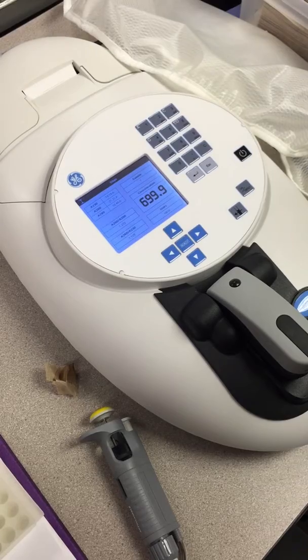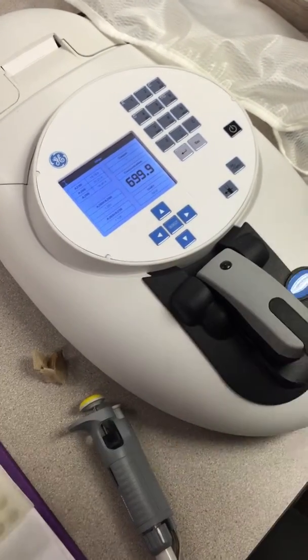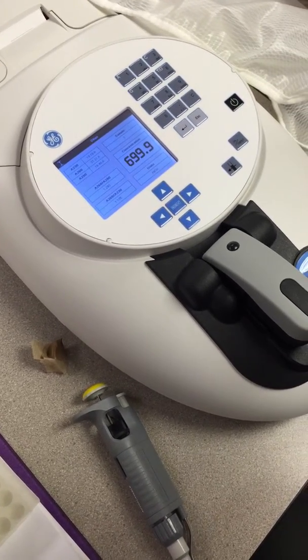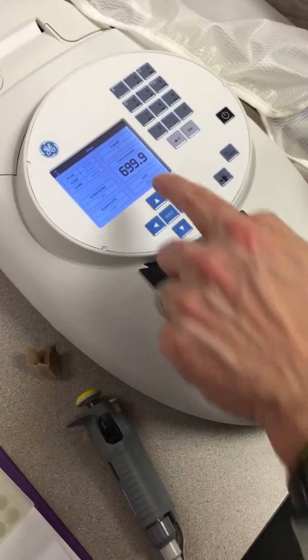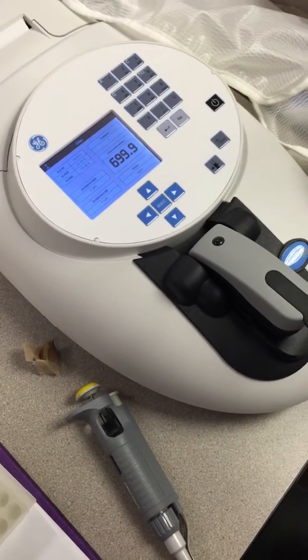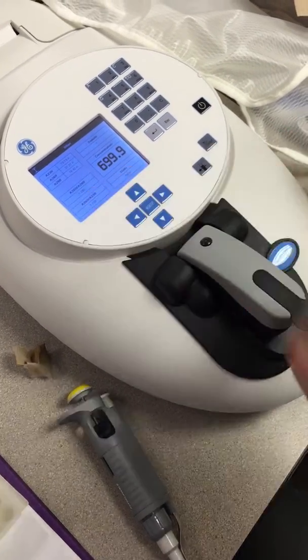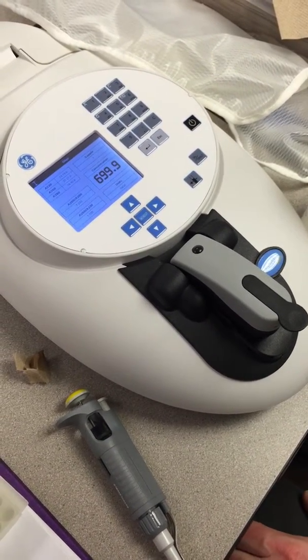We'll repeat that process a second time to confirm the reading. You can also do dilutions if you're extremely concerned about getting exceptionally accurate readings, and or if you're worried about saturating your signal there. So we should probably dilute it down. The concentration's pretty high there, and we may be seeing a little bit of saturation. So we'll probably end up diluting it a little bit just to test to make sure it's still within the linear range of the machine. Anyway, that's the main idea.